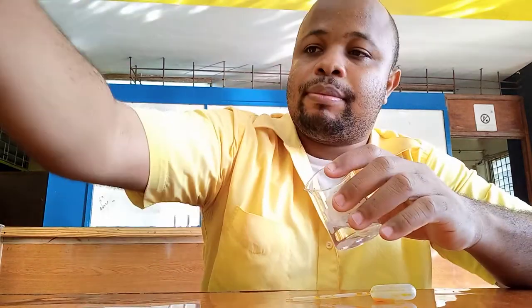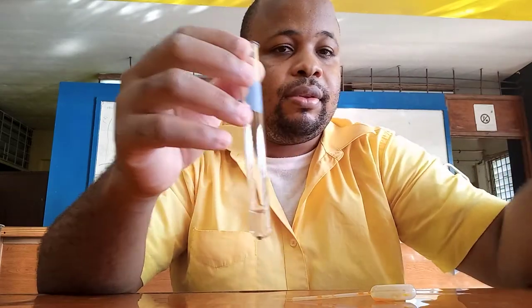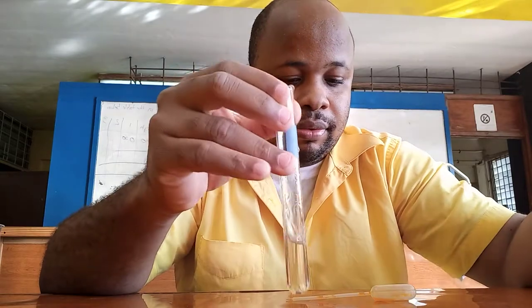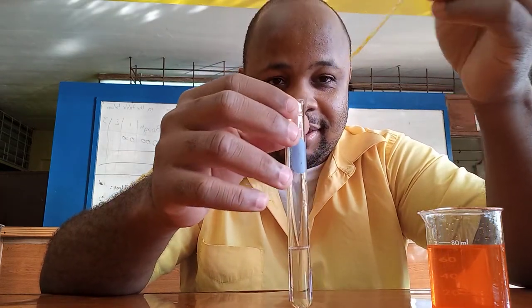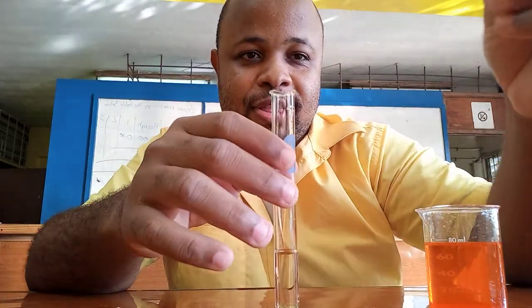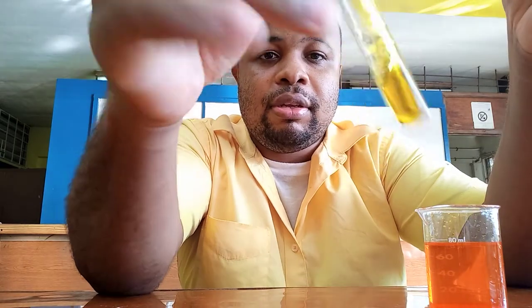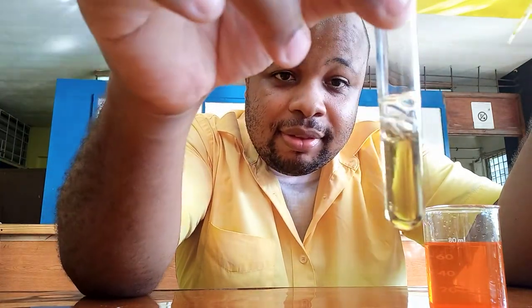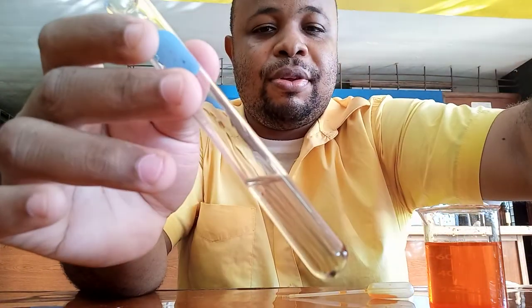Let's try alcohol C, because we know alcohol B is not going to give a reaction. We'll add the potassium dichromate. You should be able to see the color changing — let me put it against a white background so you can see it more clearly.